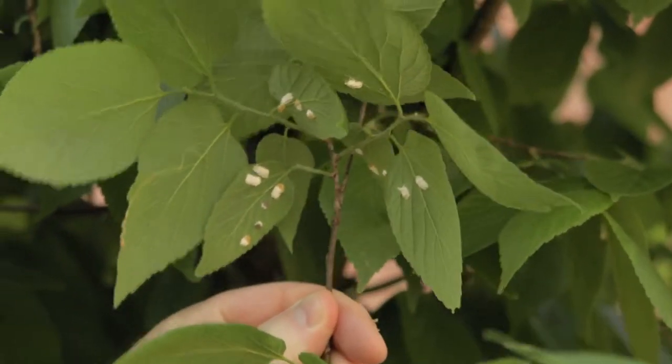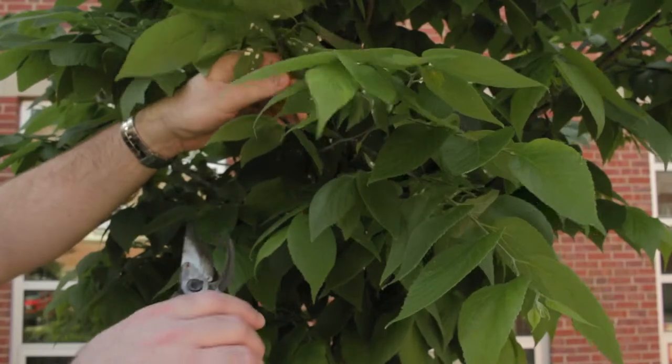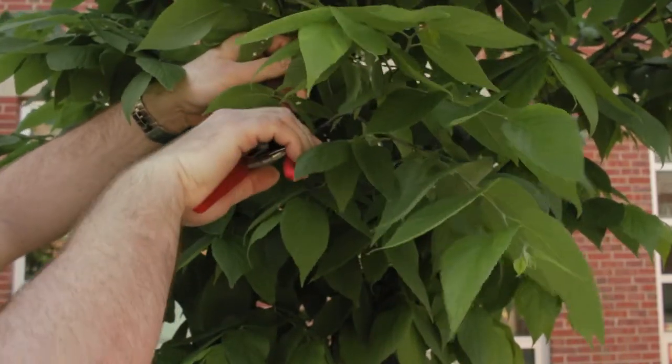When you've located insects on the plant, you can prune out that part of the plant or send in the entire plant with the insects on it.